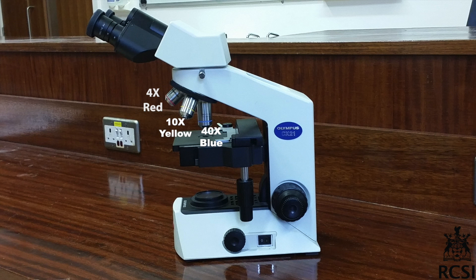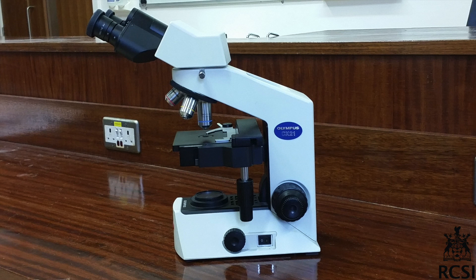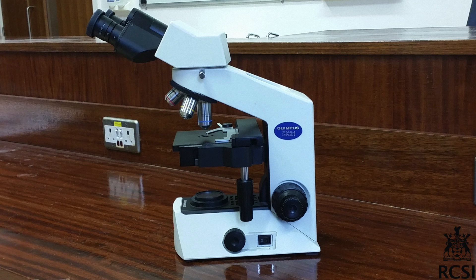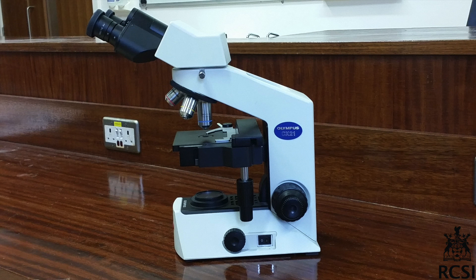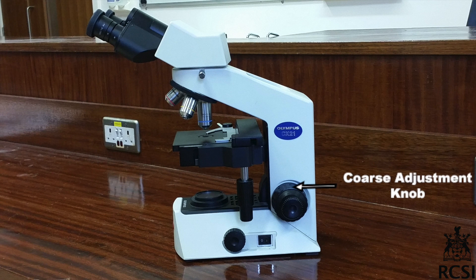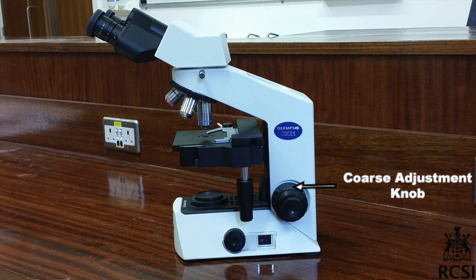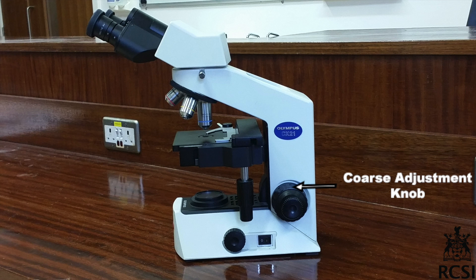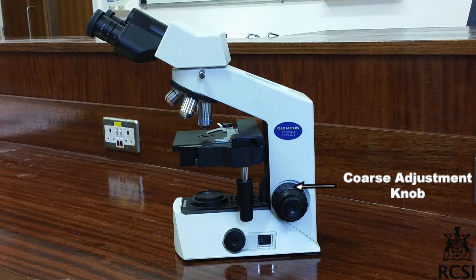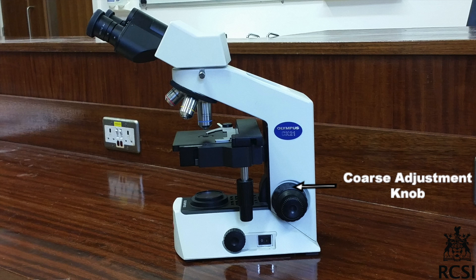The 10x power lens is yellow. There are two adjustment knobs used for focusing: the coarse adjustment knob and the fine adjustment knob. The coarse adjustment knob moves the stage up or down to focus on the slide, and this causes significant movement. Always use the coarse adjustment knob first.